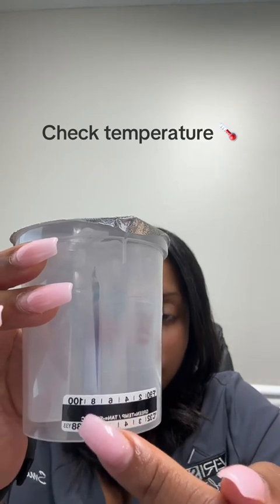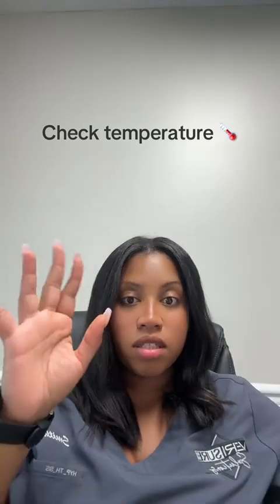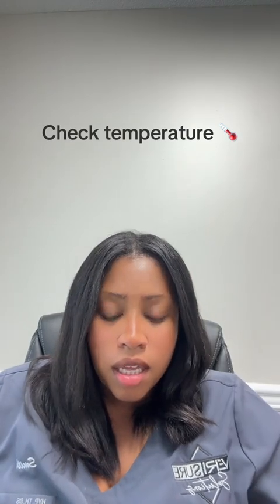It does turn green. Sometimes it can turn a tannish kind of color, but as long as that strip turns tan or green or blue even, I believe, then they're good to go. The temperature is in range. So the donor is going to come out with this thing full. Again, you're going to check the temperature strip.